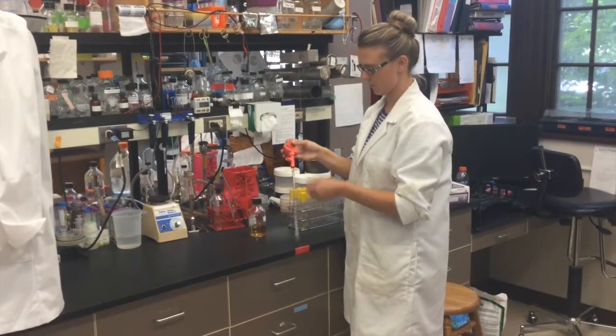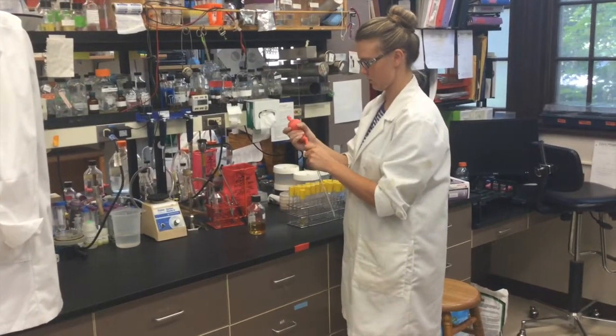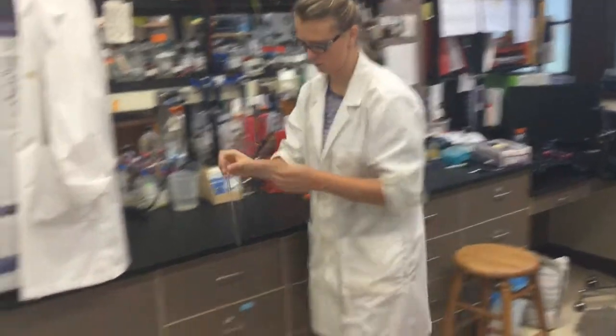After you are finished, remove the bulb from the pipette and discard the pipette into the designated bucket to be cleaned.